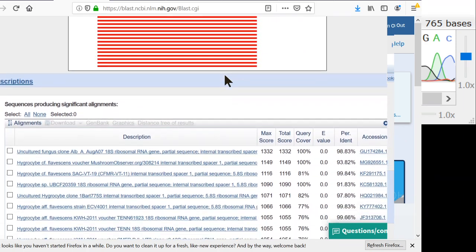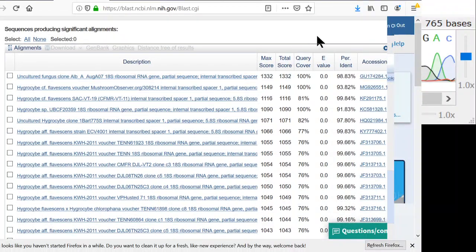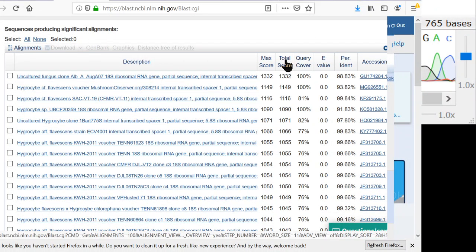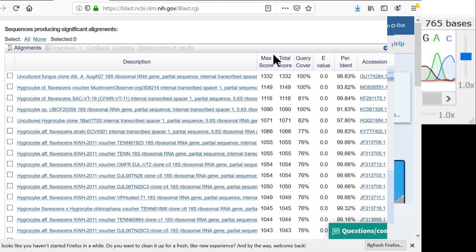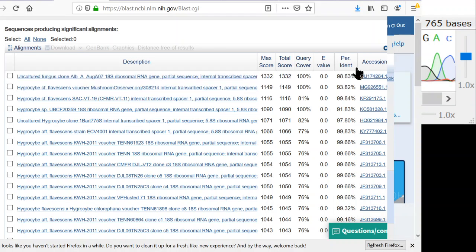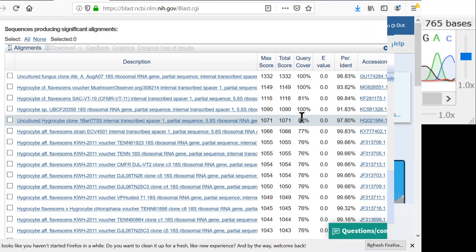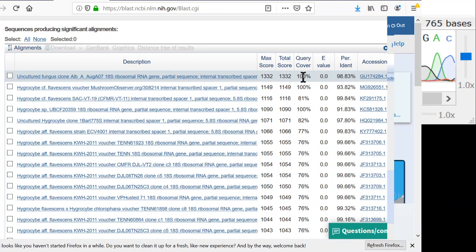Scrolling down, here we have our matches. Right now it's sorted by total score, but you can click on any of these different columns to sort by whichever column you want. The most important ones to look at are query coverage and percent identity. Query coverage is how much my sequence overlaps with the sequence we're comparing to. So 100% is really good. It overlaps all the way. That means our sequences are either the same size or the sequence I'm comparing to is larger than my sequence.